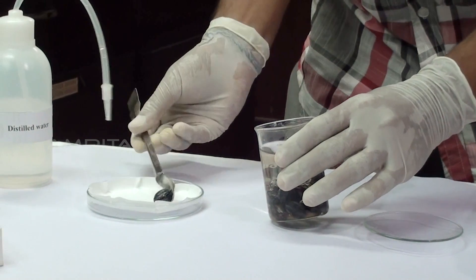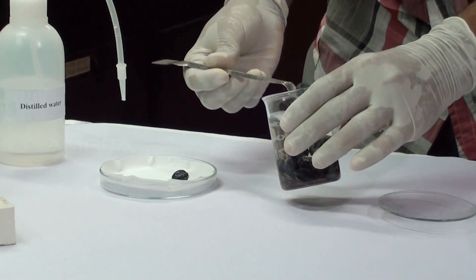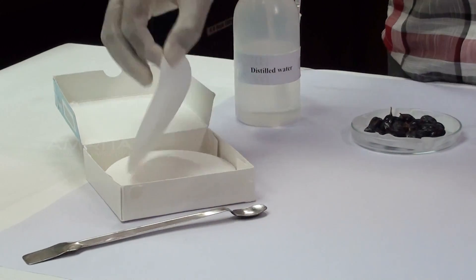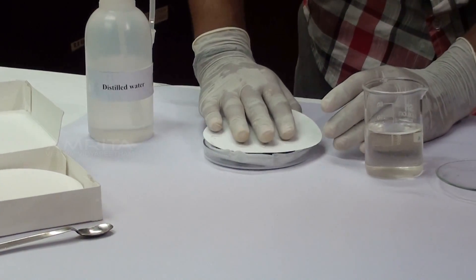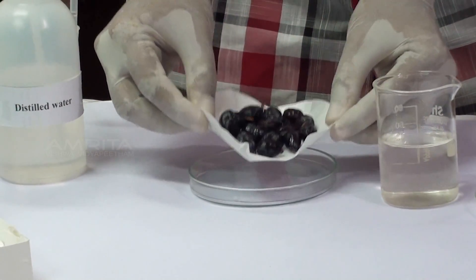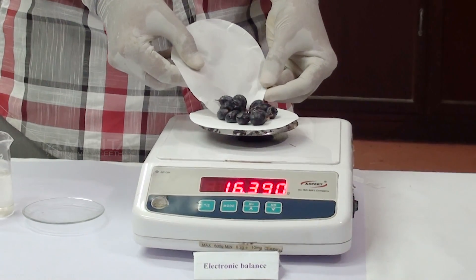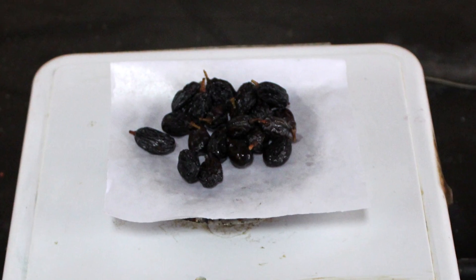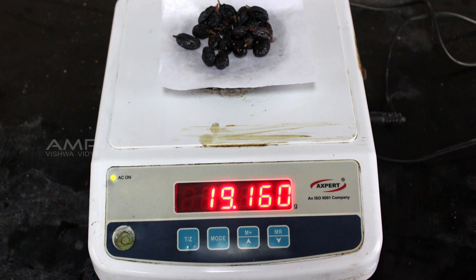Take out the swollen raisins from the water using a spatula and put them in a Petri dish containing blotting paper. Gently dry the raisins with another blotting paper. Weigh the swollen raisins using the electronic balance and note the weight. In this case, the weight of the swollen raisins is 19.160 g.